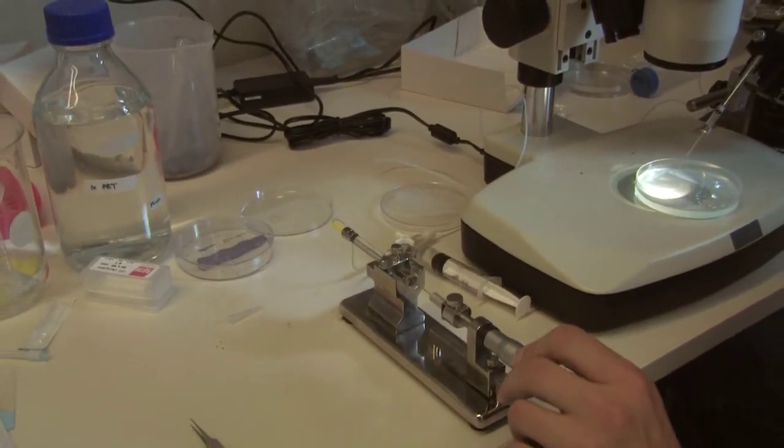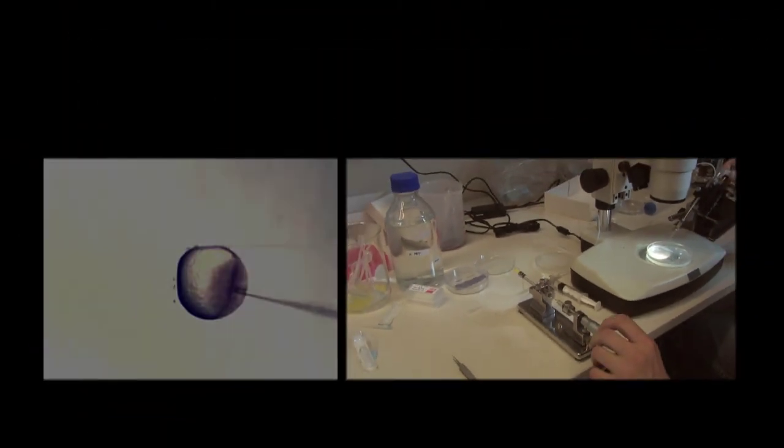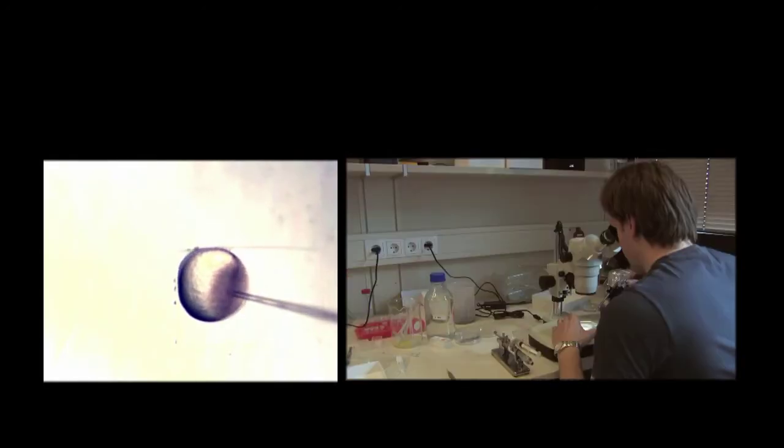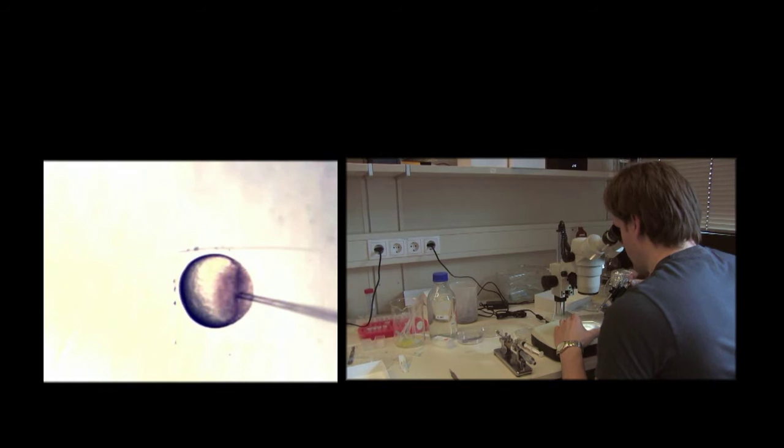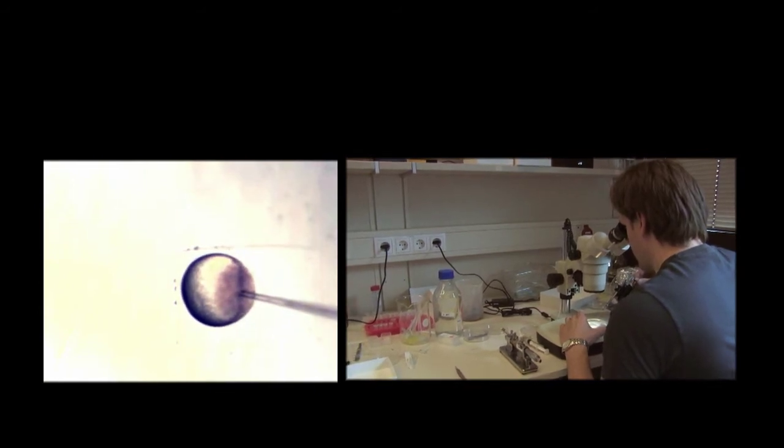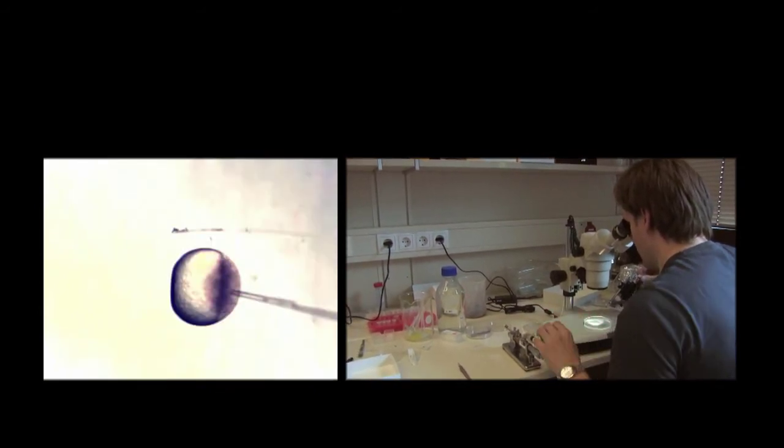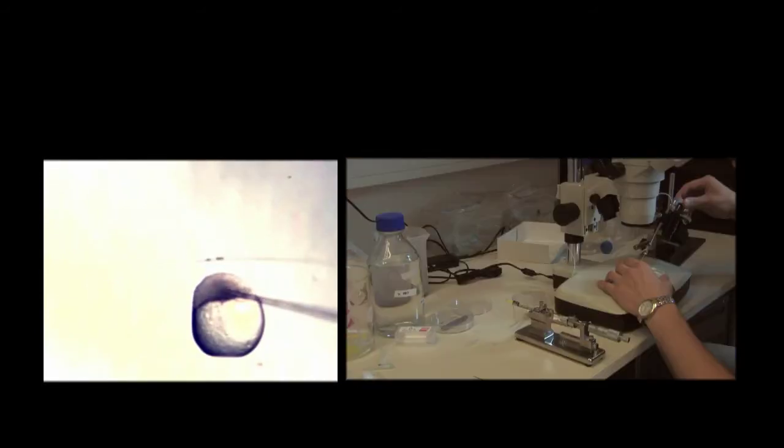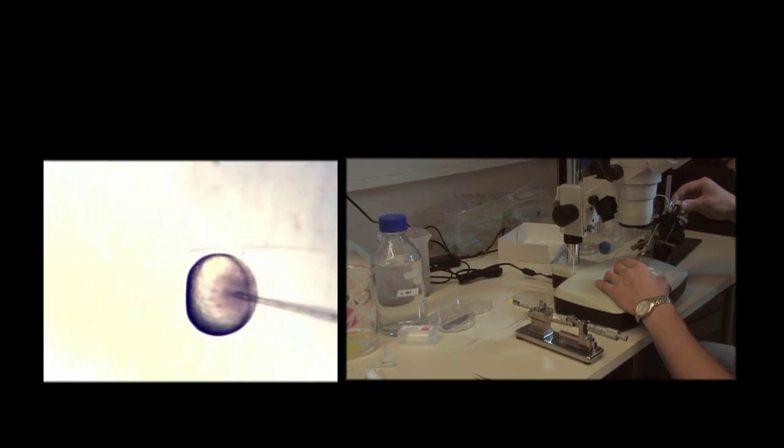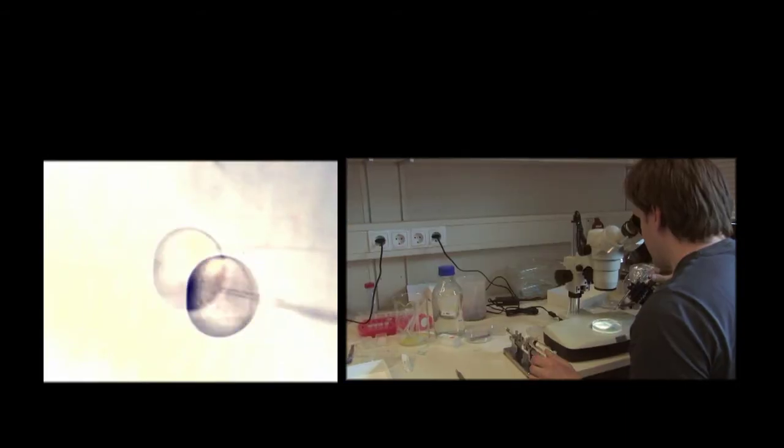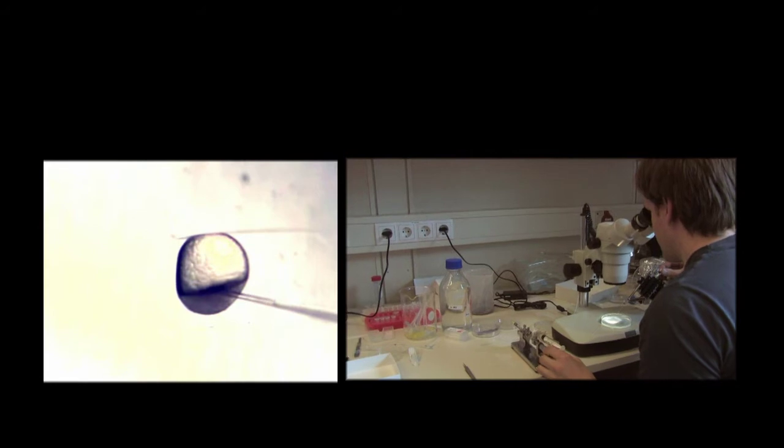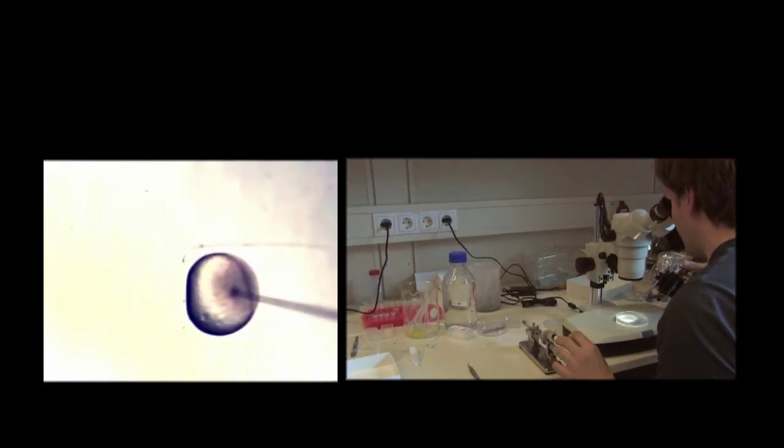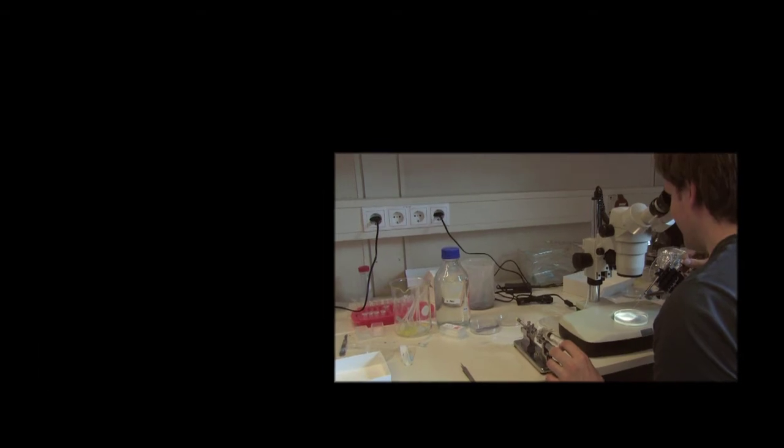I will connect the needle to an embryo, to the surface of the embryo, and then I soak up the oil level and therefore we soak up some water, of course, and some cells. Okay, now the cells are in the needle. And then I can go to another host embryo and try to release the cells very slowly and gently. Okay, now they are in.